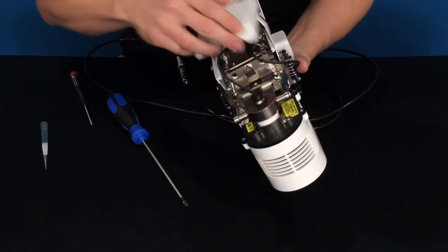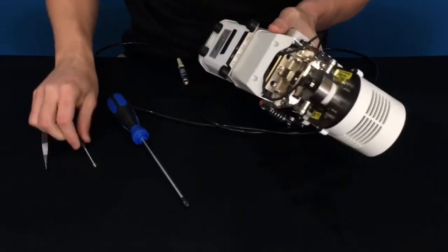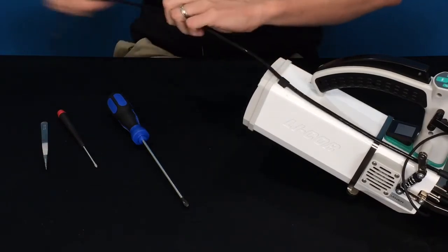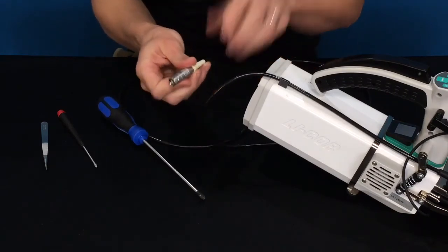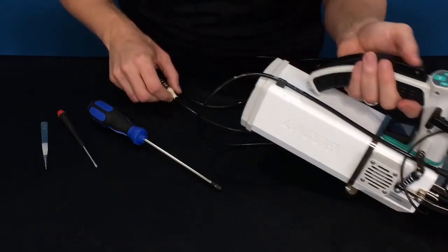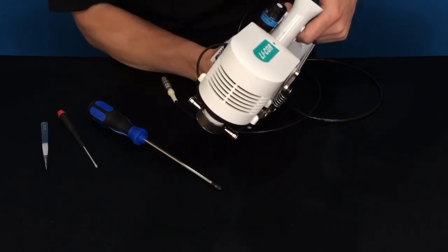Make sure not to pinch any of the wires — push them to the middle, which is where they're designed to be. Tighten the two skid plate screws. The fluorometer cable can be run through the cable bundle with the other head cable for convenience. This end gets plugged into the sensor 2 port on the console — it plugs in just like the sensor head plugs into your console, and there's a red dot to help ensure good alignment. Make sure everything seems tight and you have a good seal. It can go through all three positions: open, park, and closed. Then you should be ready to go.